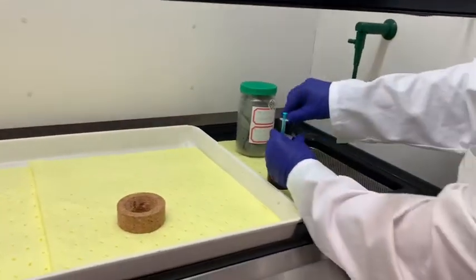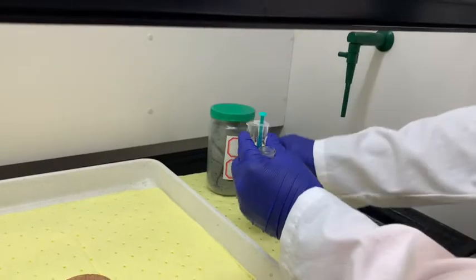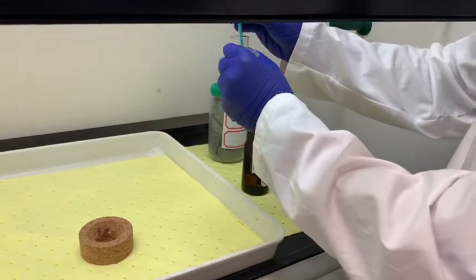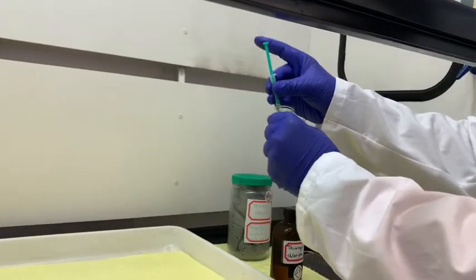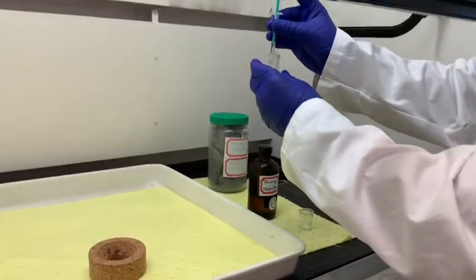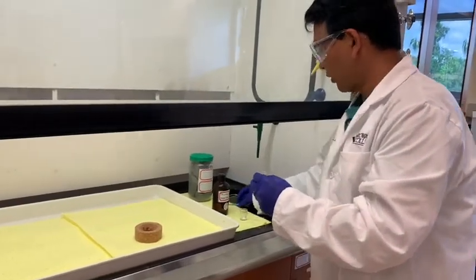So this is thionyl chloride, as you can see here. I will pour a little bit here. See, it is fuming. You can see that there. You don't want to smell this fume. So we will use a little bit of this here, and this is how much I take. From here, I will use 0.5 milliliter. Yes, this is 0.5 milliliter of thionyl chloride, and I am going to add that here in the reaction flask. So this is 0.5 milliliter of thionyl chloride and 0.4 gram of toluic acid.